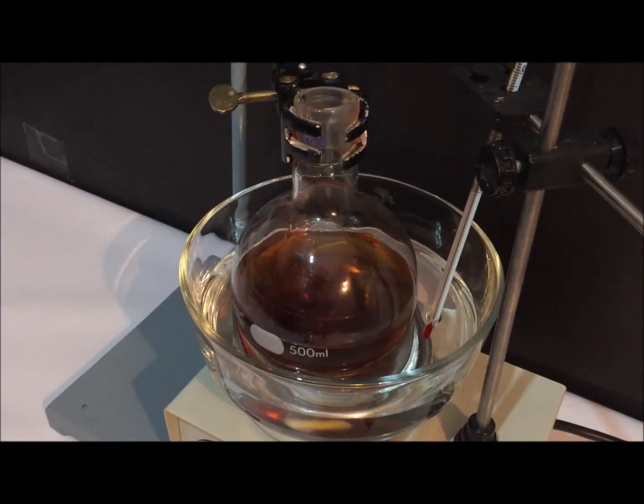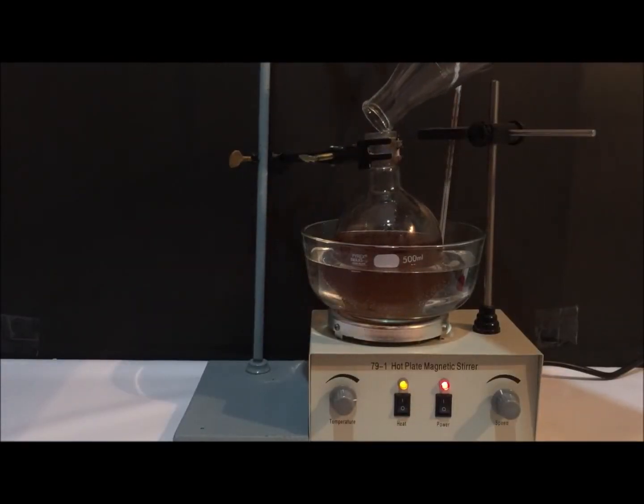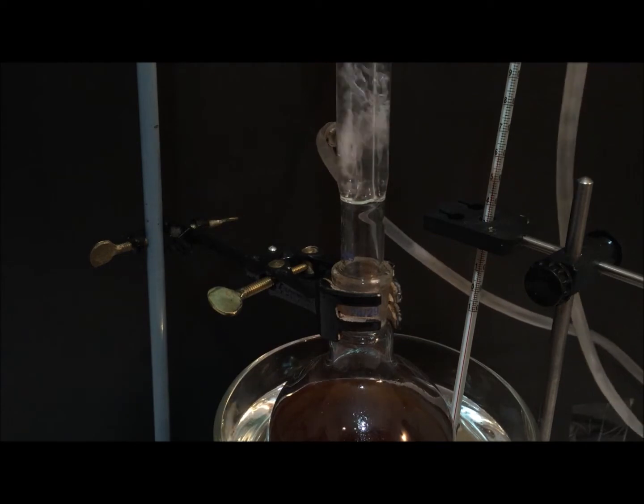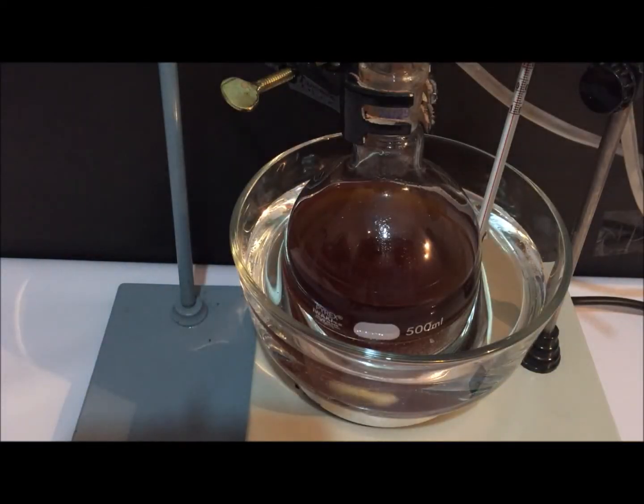The round bottom flask containing the oil is set in a water bath that is heated to the reaction temperature, in our case 60 degrees Celsius with strong stirring. Once the temperature reaches 60 degrees Celsius, as shown here, the potassium hydroxide in methanol solution is added into the reaction mixture and a condenser column is set to avoid the loss of methanol through evaporation. The reaction is allowed to continue for 1 hour.